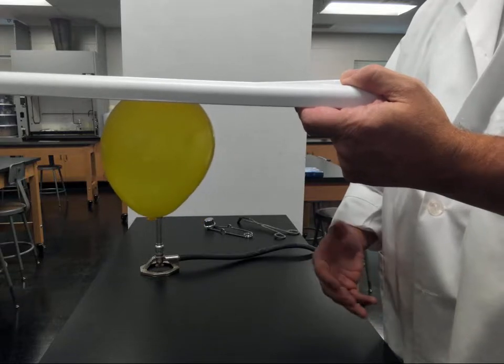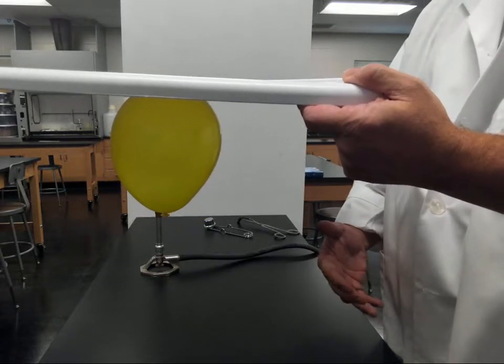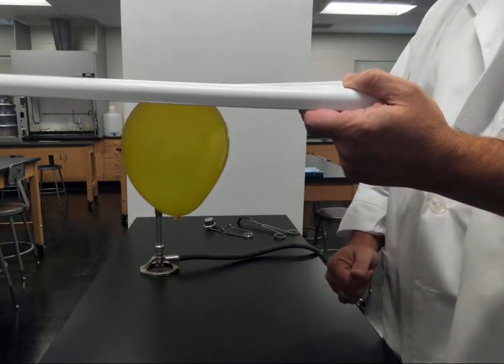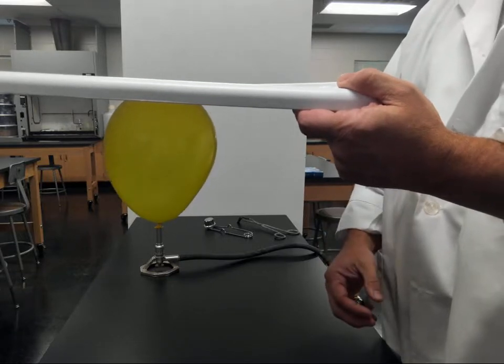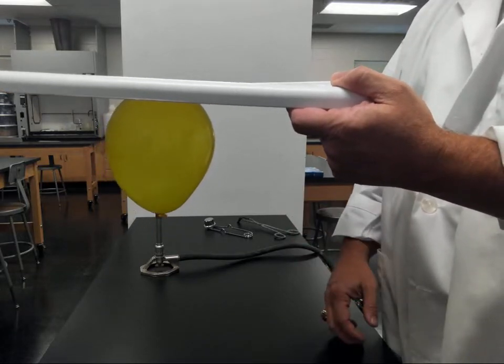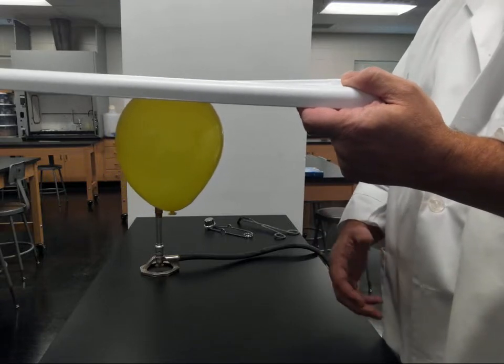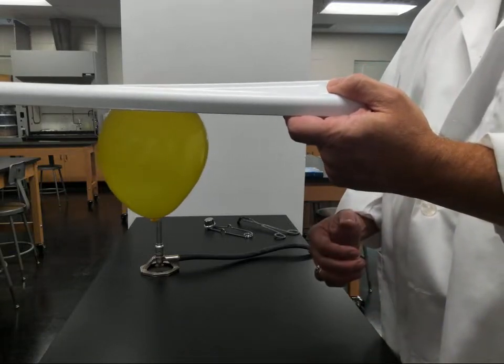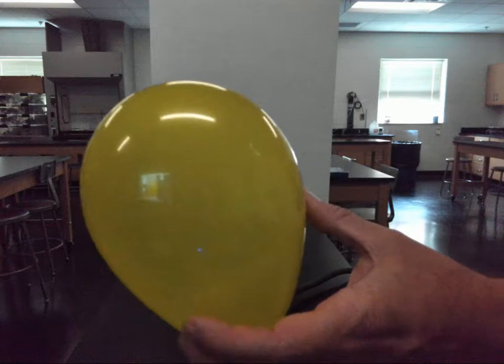At this time, I usually like to let my students do a little bit of research to see if they can find out some other properties about hydrogen. Eventually, I'm able to get out of my students that hydrogen is an excellent fuel source. I would like to show just how explosive this gas is.